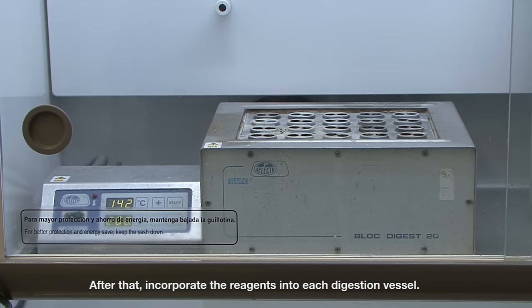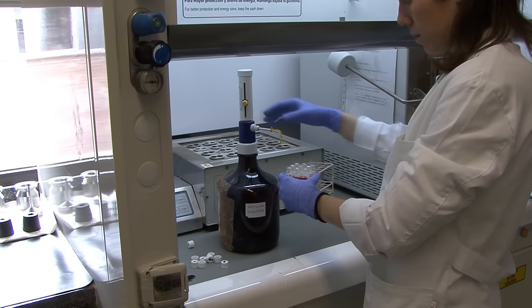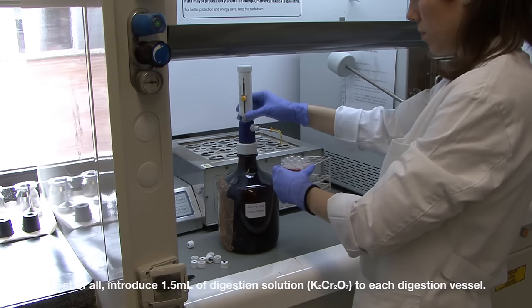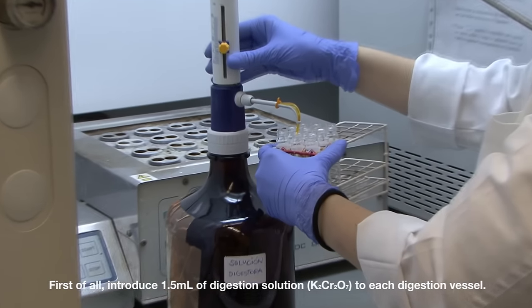After that, incorporate the reagents into each digestion vessel. Since a very exothermic reaction will occur, it must be done in the fume hood. First of all, introduce 1.5 ml of digestion solution to each digestion vessel.